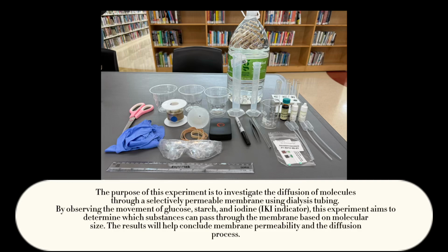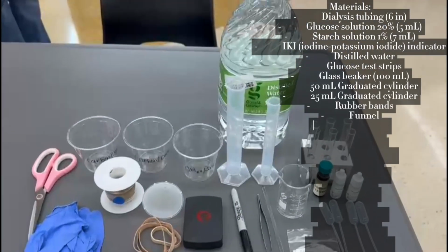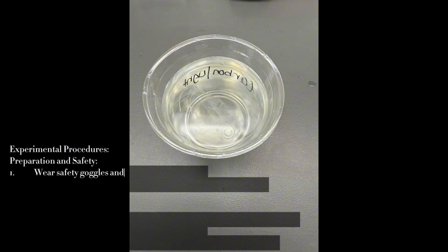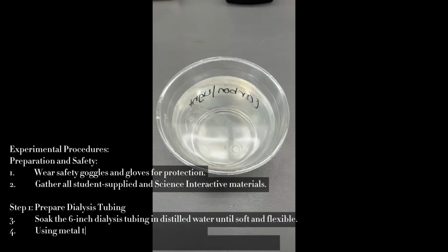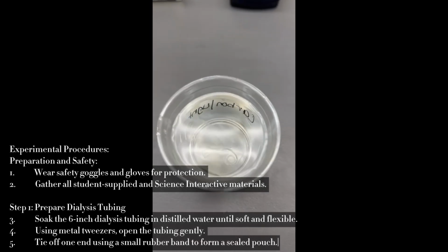In this experiment, we tested diffusion using dialysis tubing, which acts like a cell membrane. For part 1, which is our preparation, we started by putting on safety gear and gloves to protect ourselves. Then we soaked a piece of dialysis tubing in water to make it soft and easy to open.